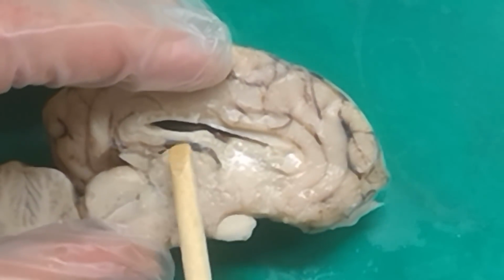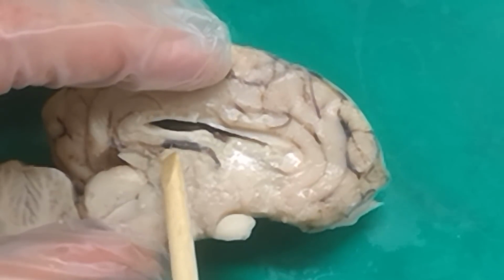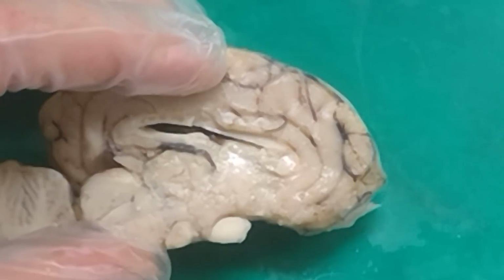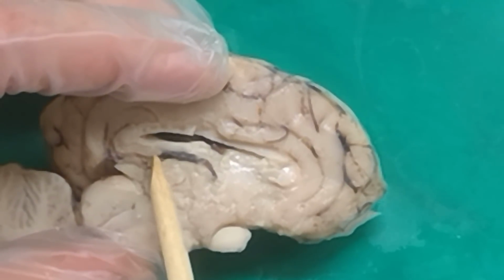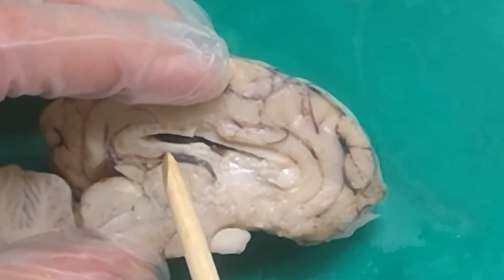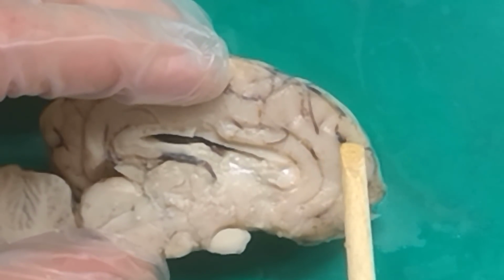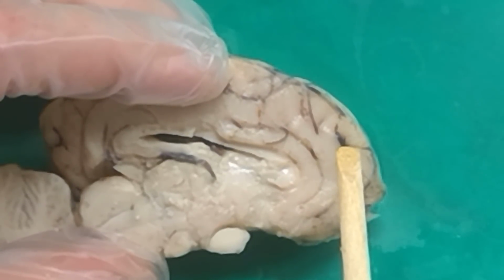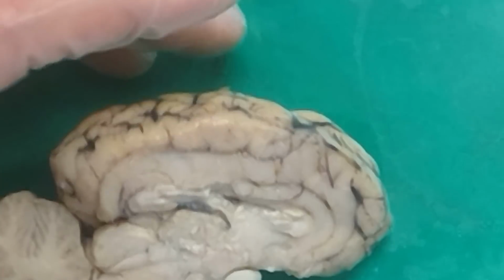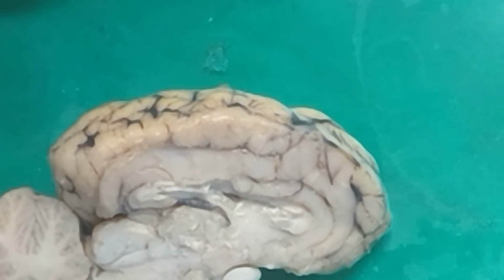The habenula is on the very back part of this thalamus right here. It's sort of a bump that's like right there. So if you saw a pin towards the very back end of the thalamus and it said name this specific nucleus, that's what I would be aware of as being the habenula. Yes. The septum pellucidum. It's the membrane that's separating the two sides of the lateral ventricles from each other.